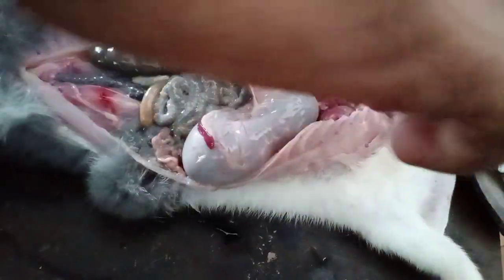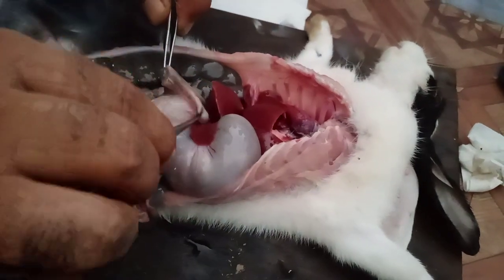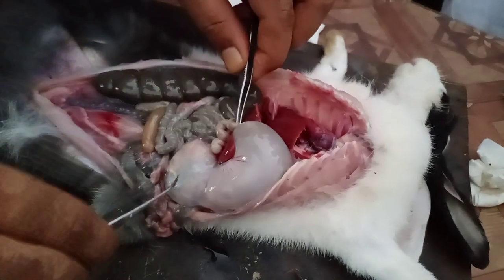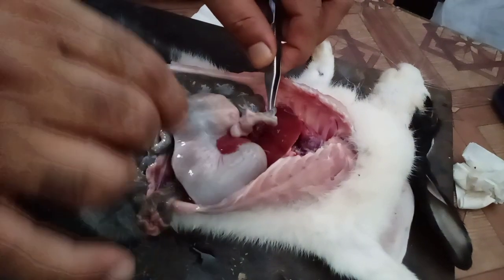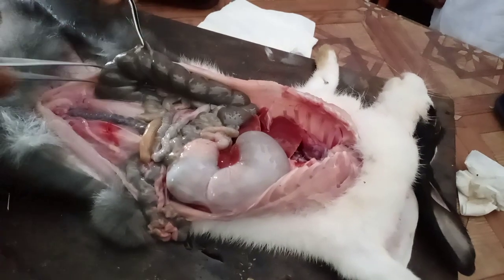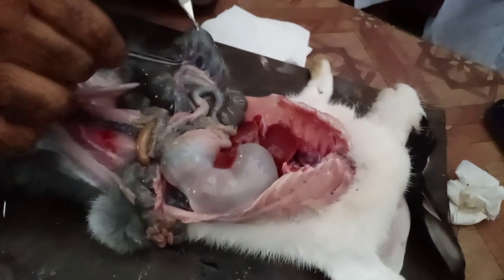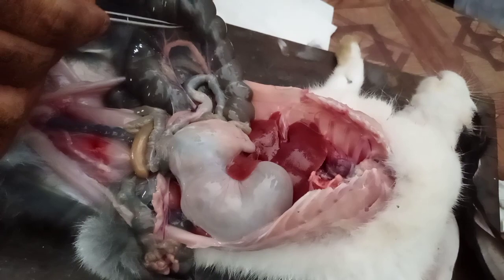This is the duodenum — this one is the duodenum, and it ends at the junction of the jejunum. This is the jejunum, this is the ileum, and this is the large intestine. Here is the mesentery — these are the blood vessels in the mesentery, this layer.